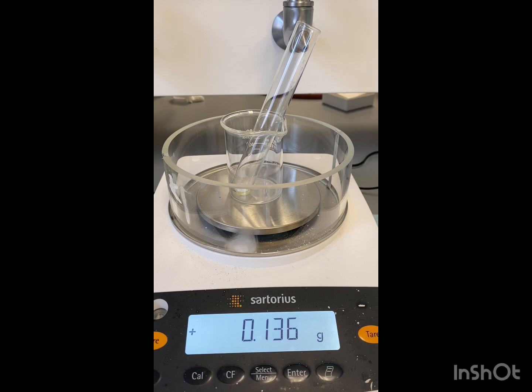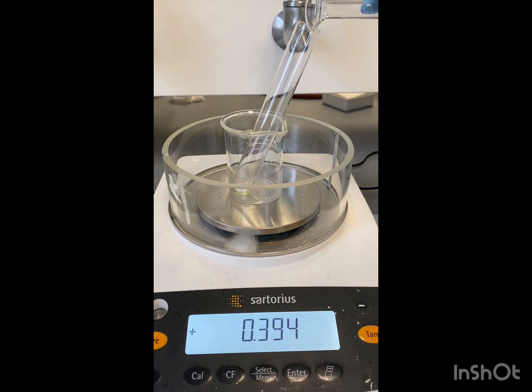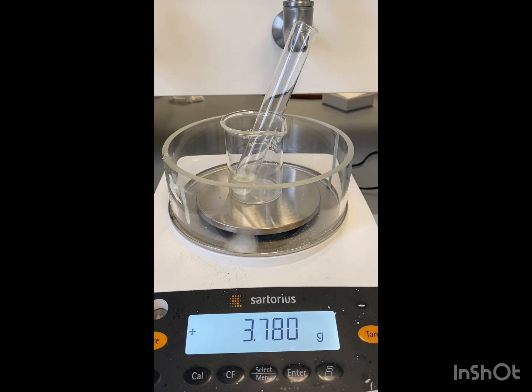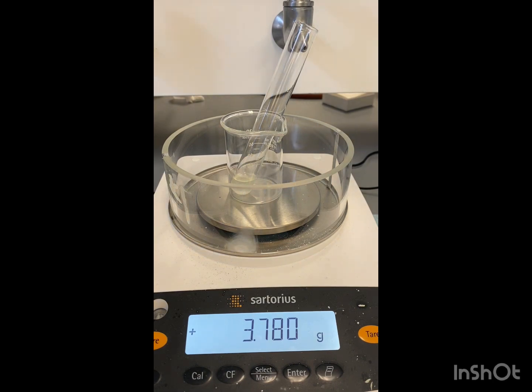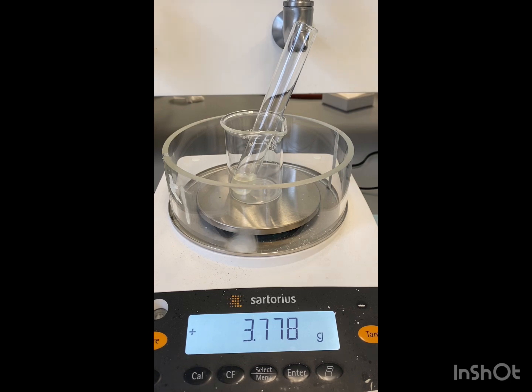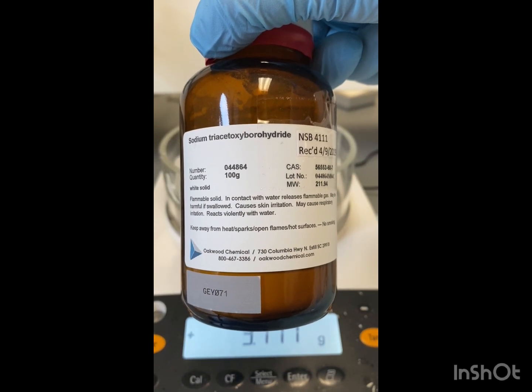Now we want 3 mL of DCM. Now we need 1.1 millimoles of sodium triacetoxyborohydride. We're going to calculate how much we need of that. There's our sodium triacetoxyborohydride.